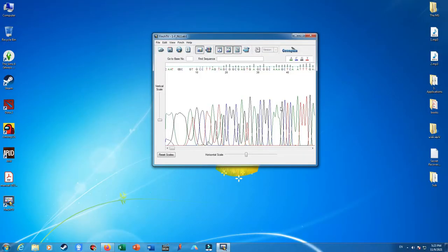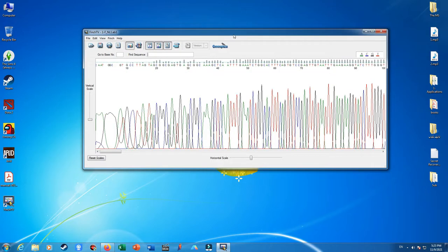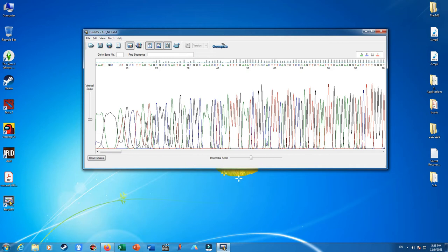Okay, here are the sequenced results of a DNA sample. I am told that this sequence belongs to a microorganism, a fungus, I think. I don't know. I will look into the quality of the sequencing with FinchTV.